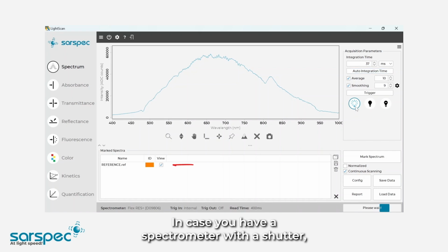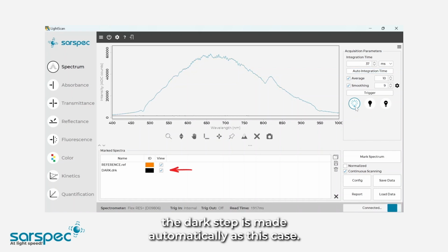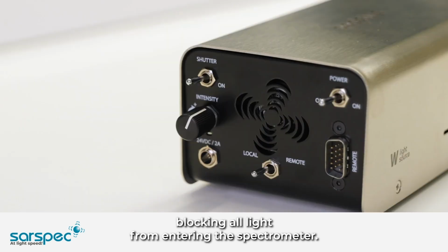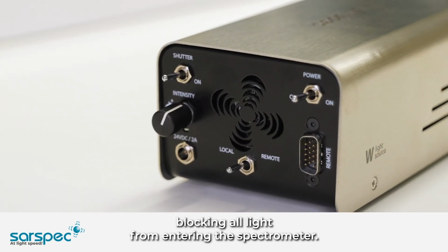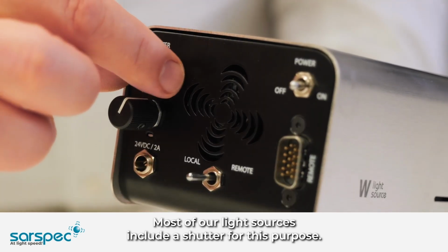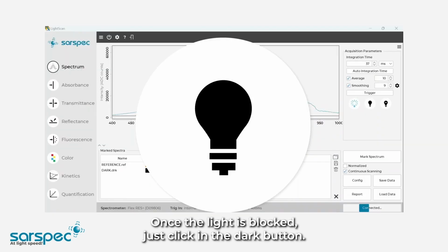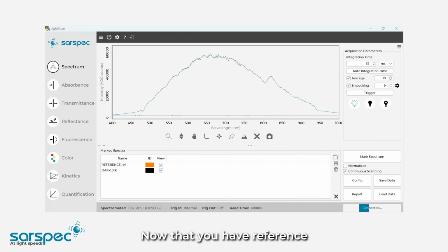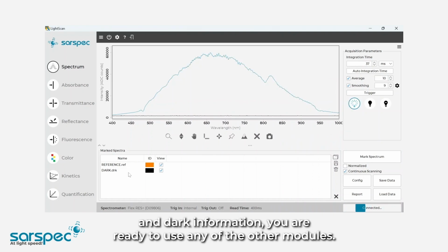In case you have a spectrometer with a shutter, the dark step is made automatically, as in this case. Otherwise, this step needs to be made after blocking all light from entering the spectrometer. Most of our light sources include a shutter for this purpose. Once the light is blocked, just click in the Dark button. Now that you have reference and dark information, you are ready to use any of the other modules.